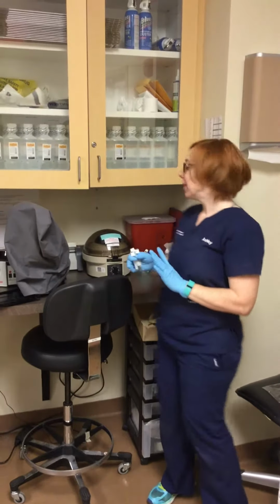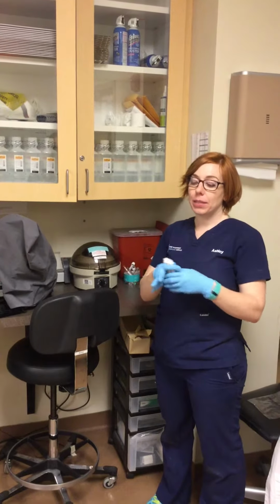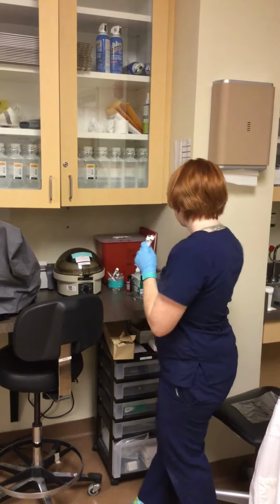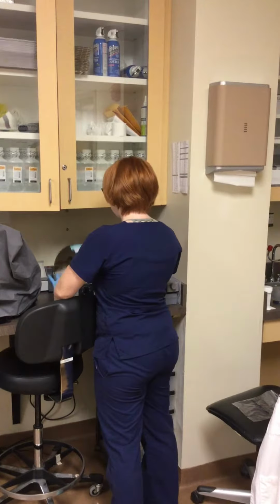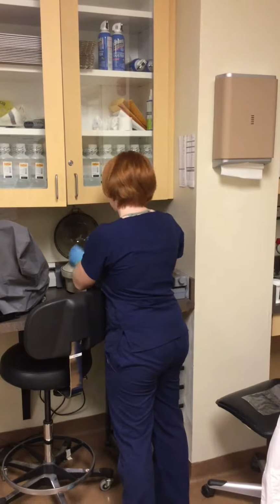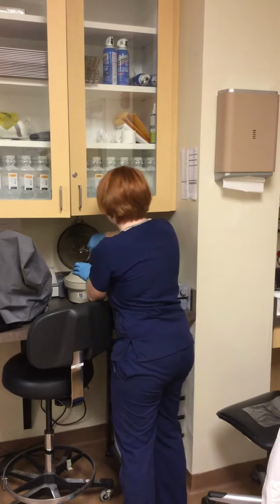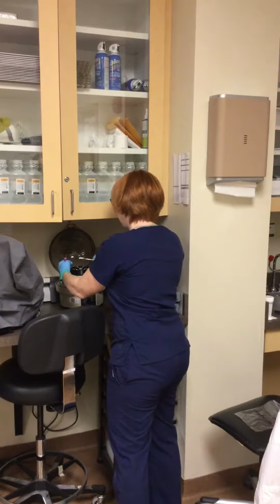Okay, so now my samples are done in the centrifuge. So what I'm going to do is remove the serum and then put them in 3 separate non-additive tubes, which are the white ones. So I have the 3 tubes and the 3 different pipettes for each tube. So I'm going to open the centrifuge here, and so that's my control balance. So that one's that. Serum for this one.